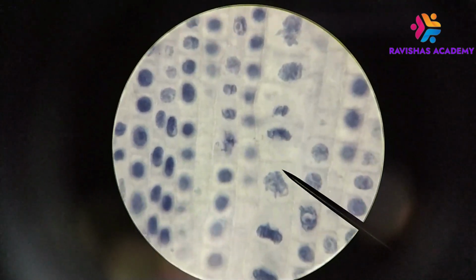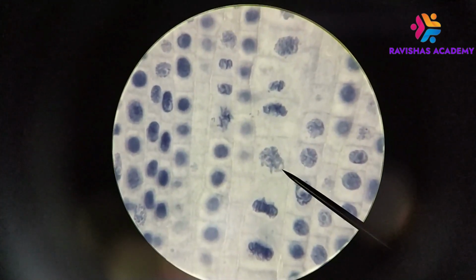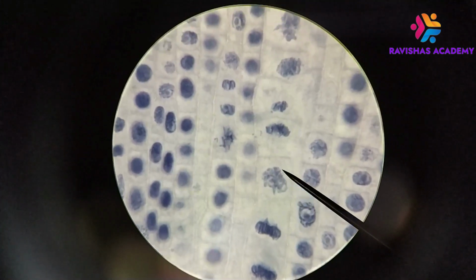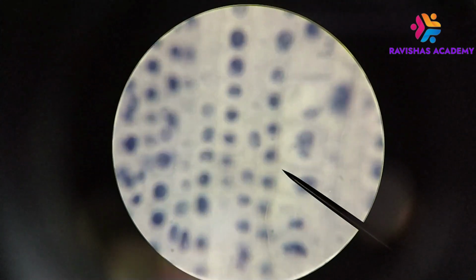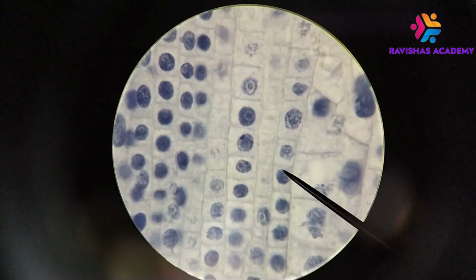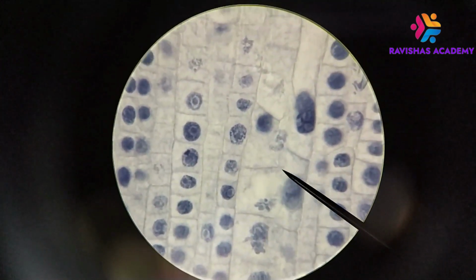So the nucleus I was looking at is this one over here. And so here you don't see a nice round nucleus anymore. What you do see are individual fairly thick strands, and those are the chromosomes. Now what you might notice is that they don't look like the chromosomes that you're used to seeing in your textbook diagrams. They don't look like little X's, not in this case. Okay, so they're relatively long still and fairly thick structures, but they are small enough to allow your cells to divide them between the two ends.